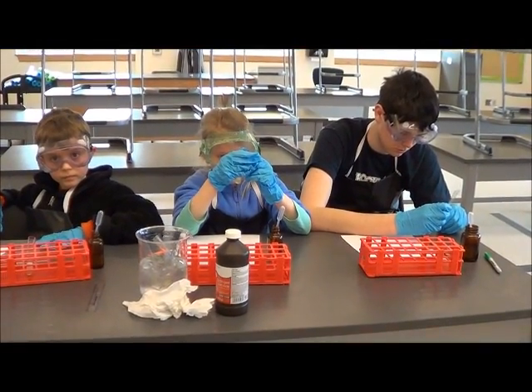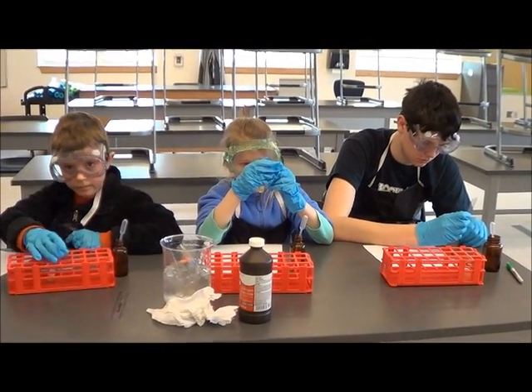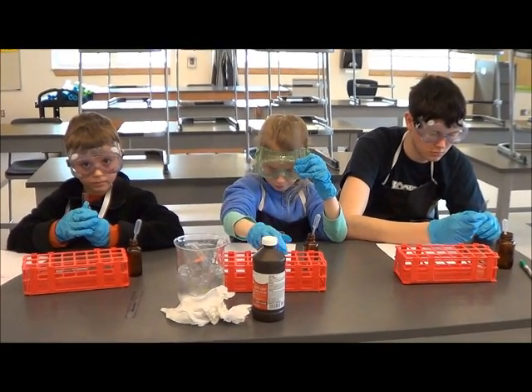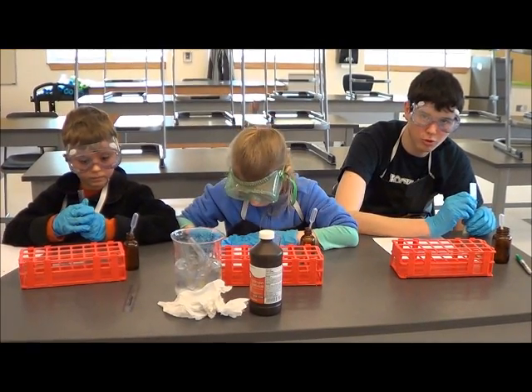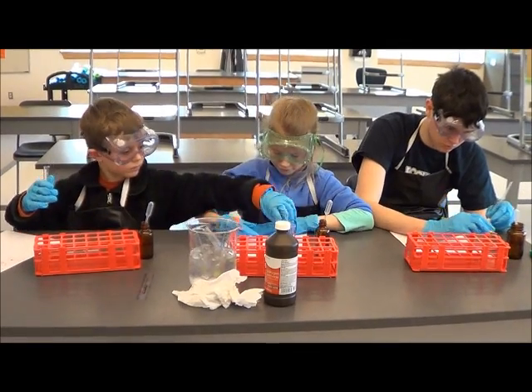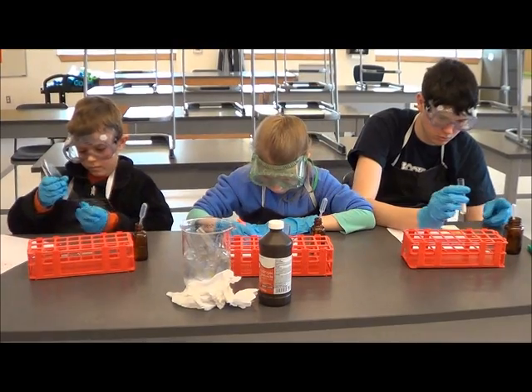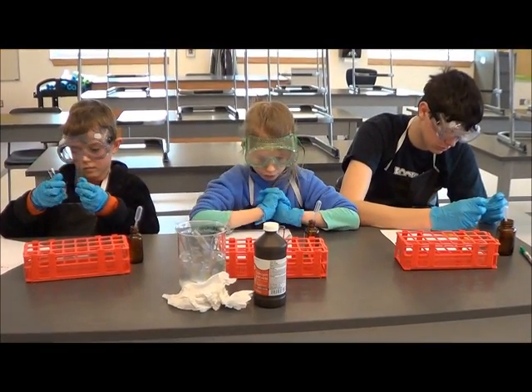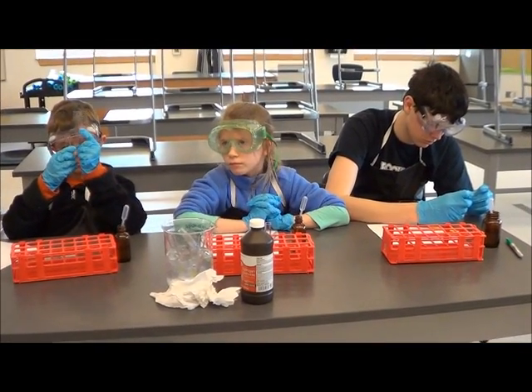Science girl, you can measure — your time's been one minute. You too, science helper. That's about three minutes. Wait ten more seconds, science boy. This one's one, so normal's one. Okay, so you're going to write it down for normal. And again, you're measuring the bubbles — you're not measuring from the bottom, right? Just in centimeters, and just the bubbles, not from the green stuff at the bottom. And you can write that down for normal.